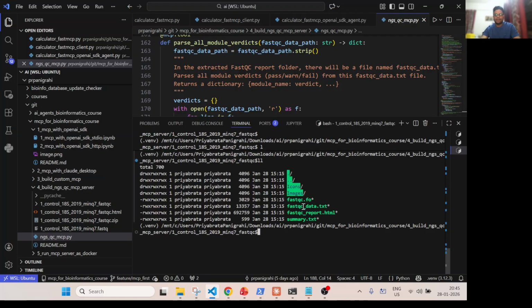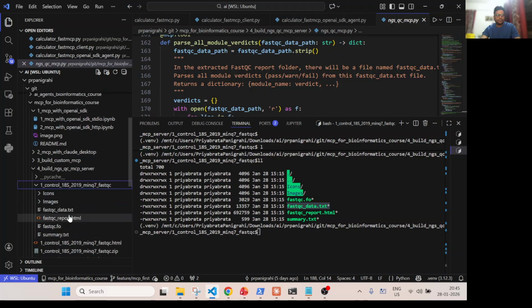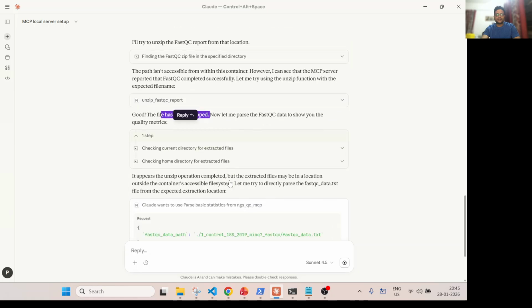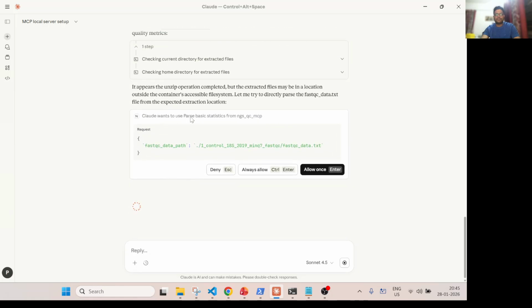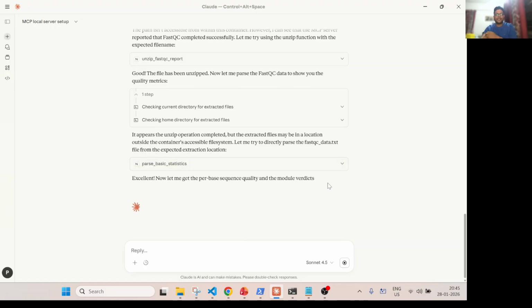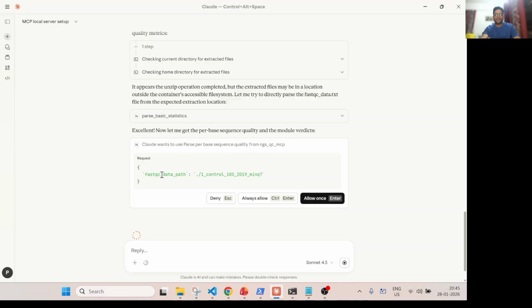So you will see here the fastqc data.txt file. Okay, so if I open this one, fastqc data.txt file, you will see the file content. So let's see what does this do. Okay, so now it tries to parse basic statistics from this file. So you found this data automatically. So let's run this parse basic statistics. Okay, so excellent.